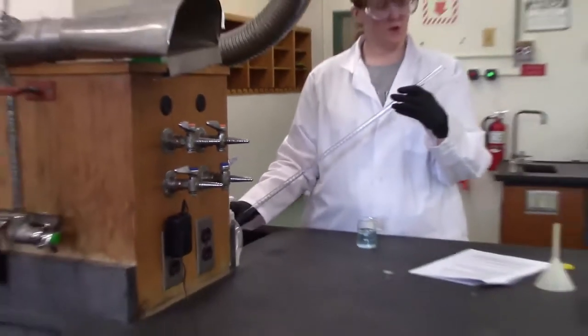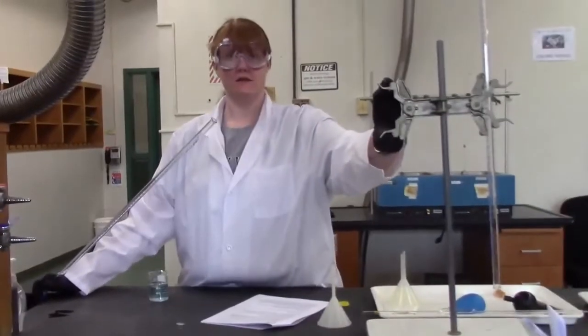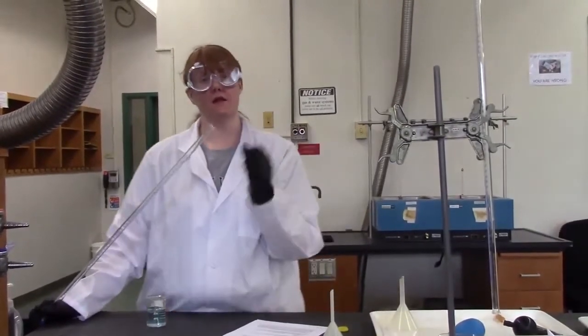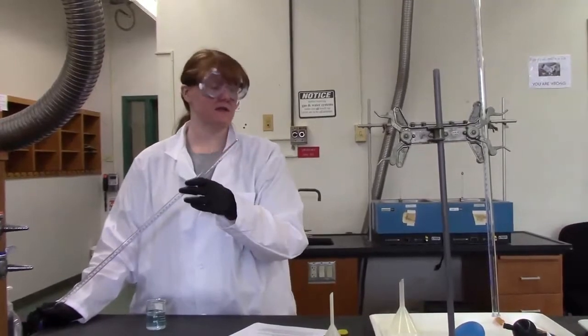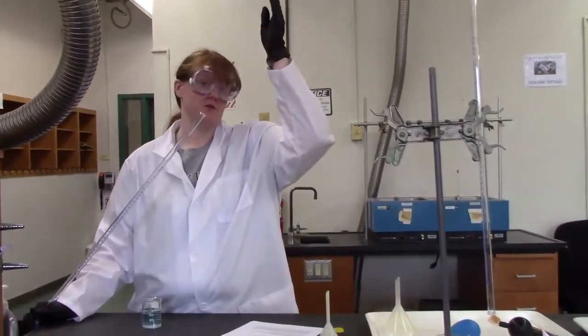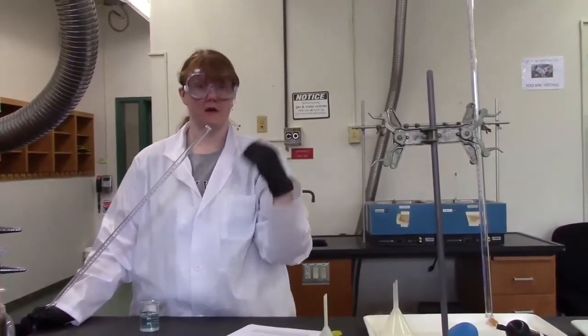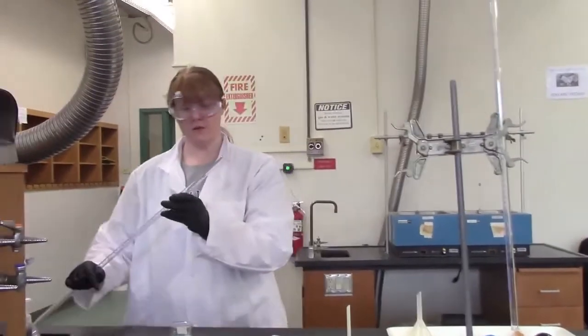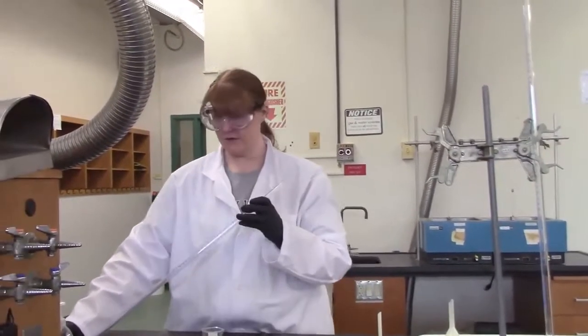What I don't want to see is the burette on the stand, and you're trying to fill it above your head. That's not safe, because then the chemicals are above your head, you don't have as much control, and they're likely to come down on your face. Once that's done, you're going to fill it completely. So I'm going to go ahead and do that.